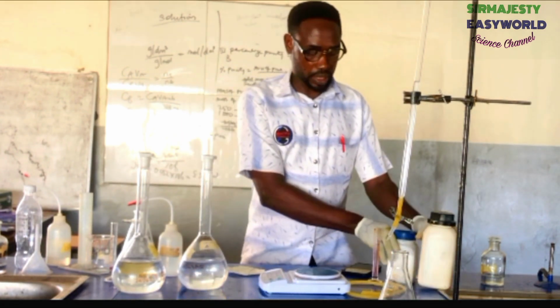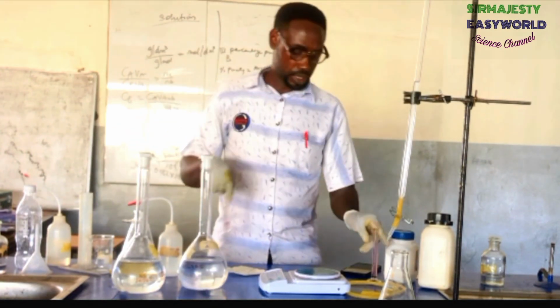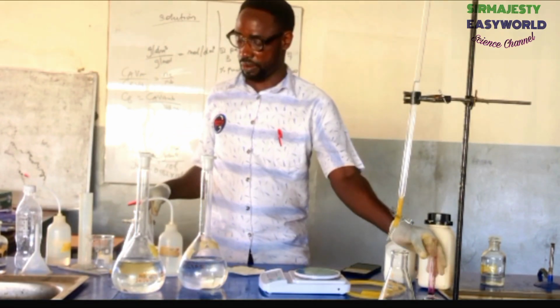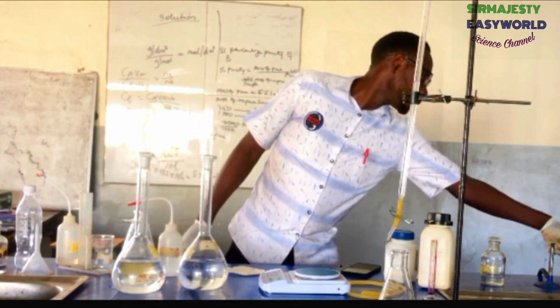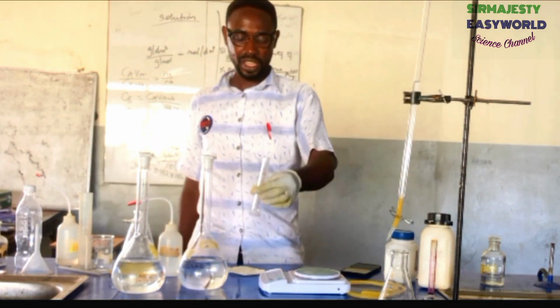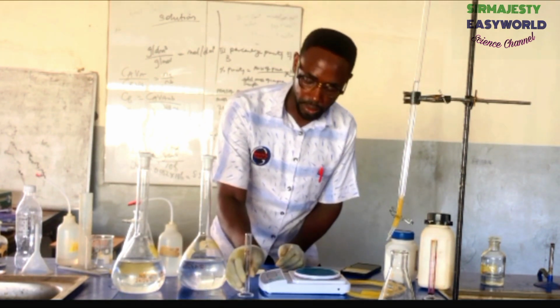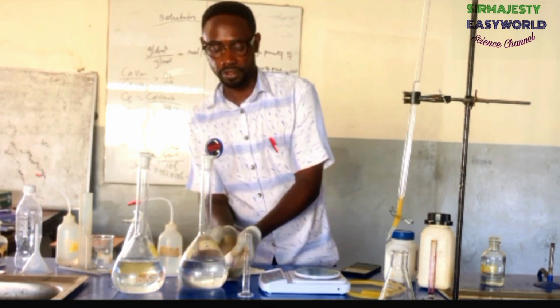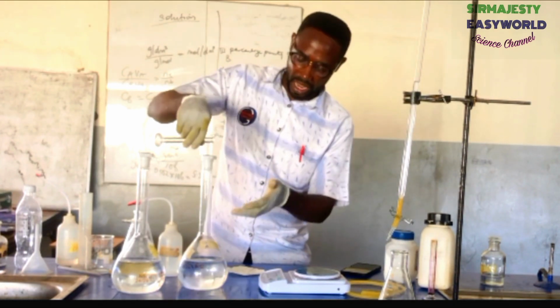A. The A there is, your job is to bring the measuring cylinder. This thing here, it contains another reaction I use it for. So this is just a measuring cylinder. You measure that 6.30 and then do what? Add some water into this, maybe to this level, and then carefully add it. Then rinse well, then add back again.